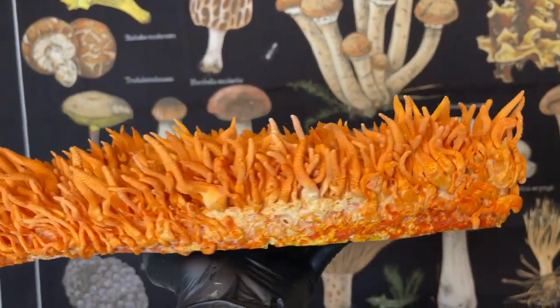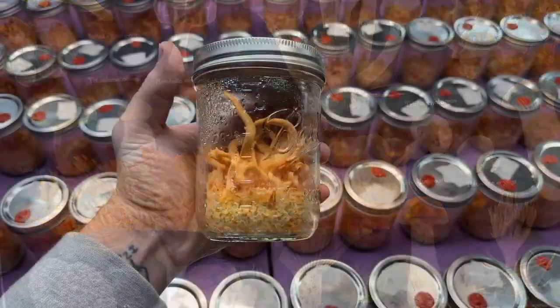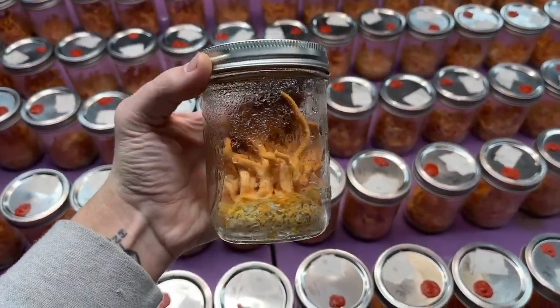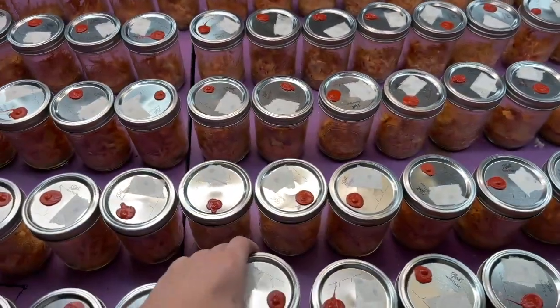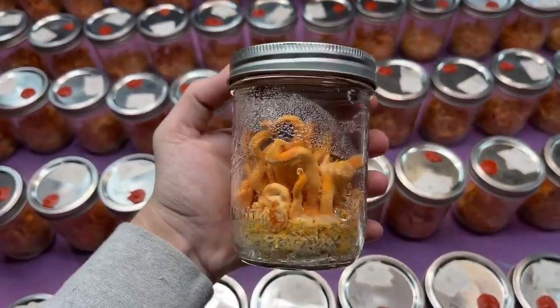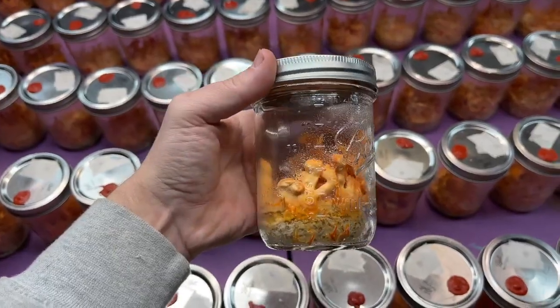First, I will show you the bulk bin method, and then I will show you the individual jar method. Cordyceps Militaris is one of the most expensive mushrooms in the world due to the medicinal compounds that they contain.